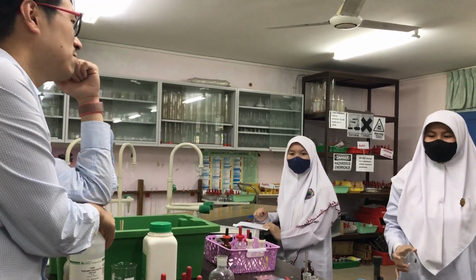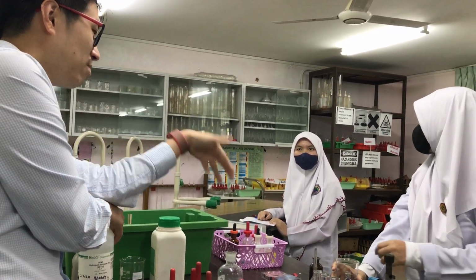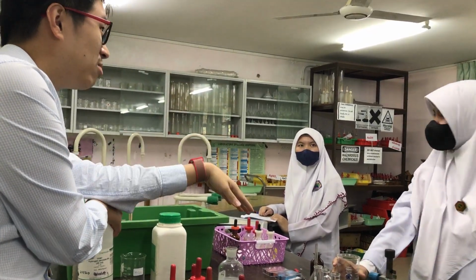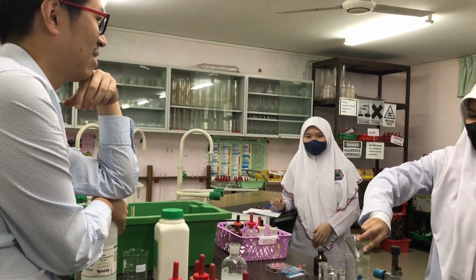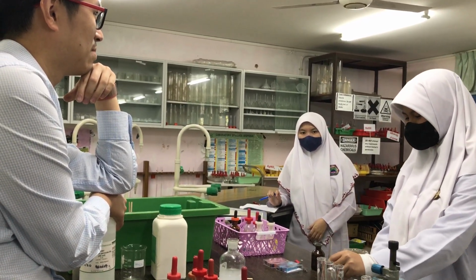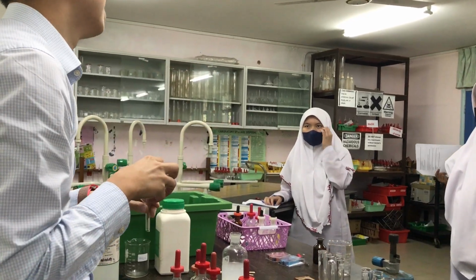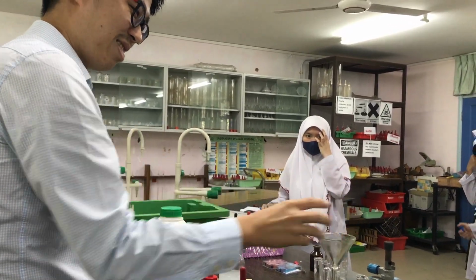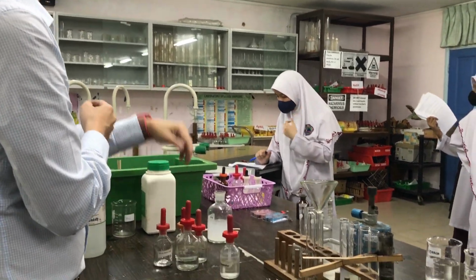Show me. How? You were the one who said it, right? So, how? No, beaker is not a good choice. Beaker is never a good choice. Test tube is not a good choice. Heavy, light. There's another apparatus there.